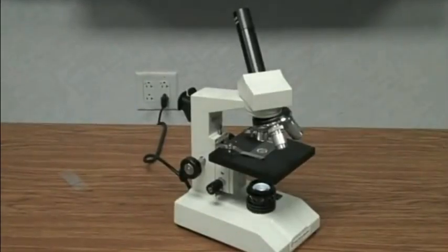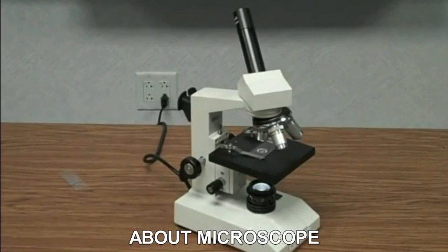So, here is my microscope. This is a compound light microscope. This particular microscope will magnify an image at 3 different levels. It uses light, and it also uses multiple lenses to magnify the image so that you can see it.